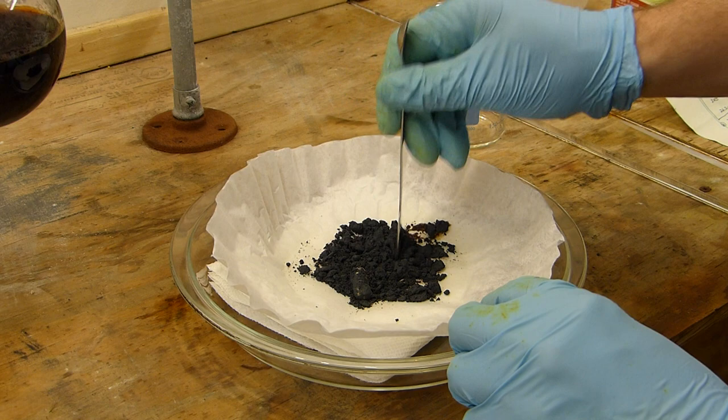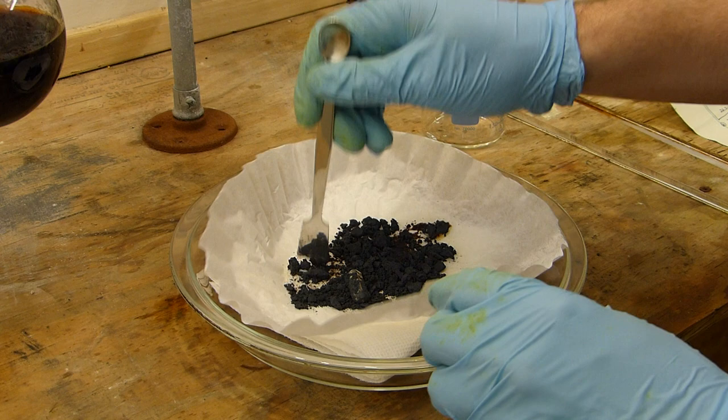And spread it as thinly as possible so that we get drying in a reasonable amount of time.